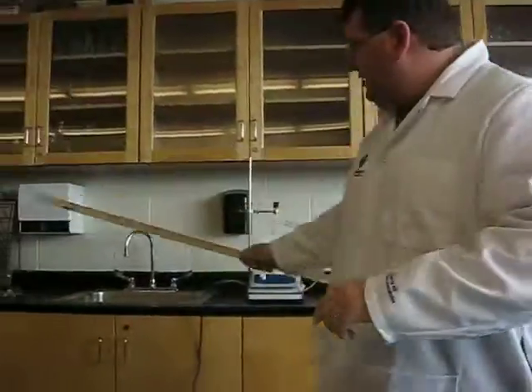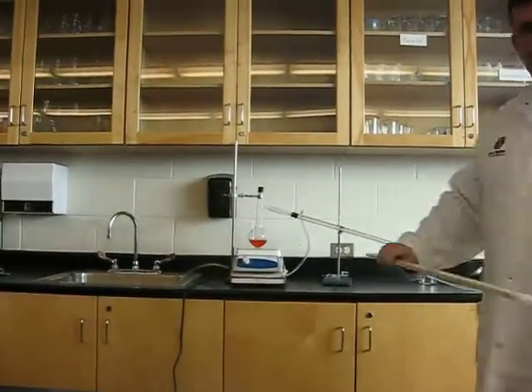Welcome to G's World! Today, in the lab, we are working on distillation. But before we start anything, safety first. Our goggles, our protective lab coat.